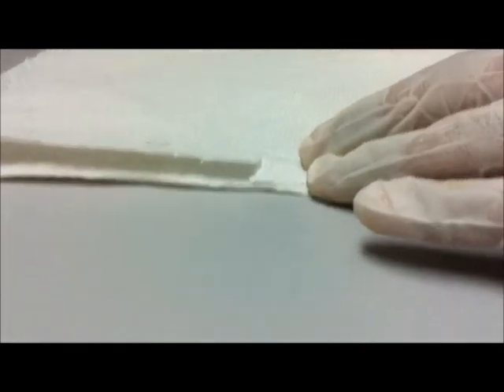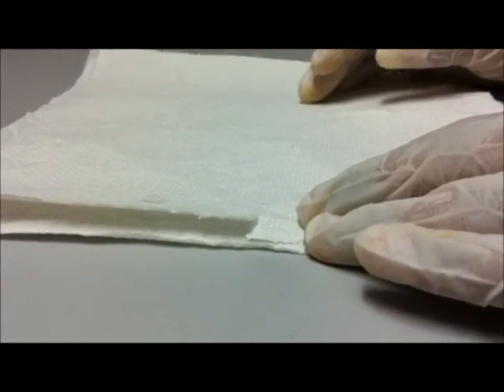Greetings fellow YouTube chemists. In this video I'm going to show you how to make copper hydroxide.